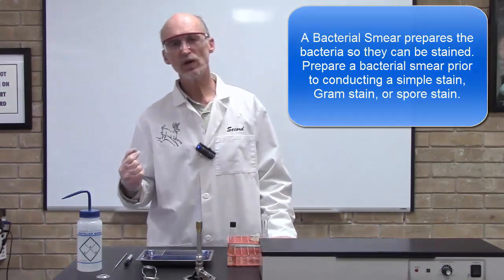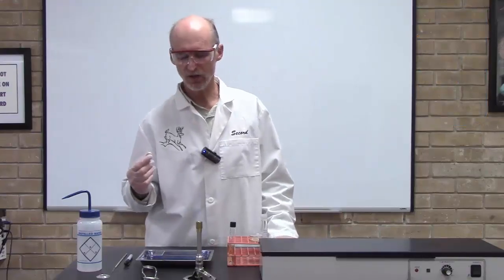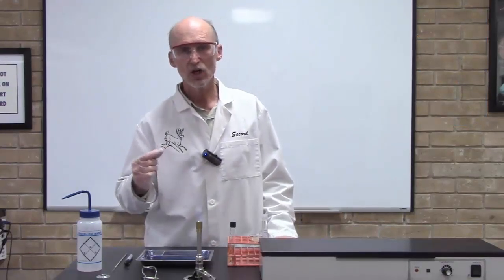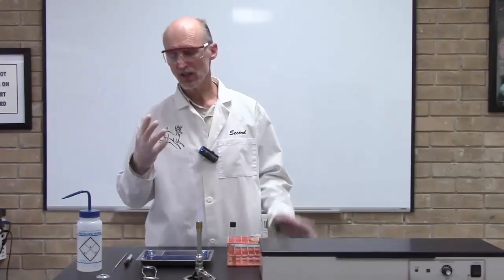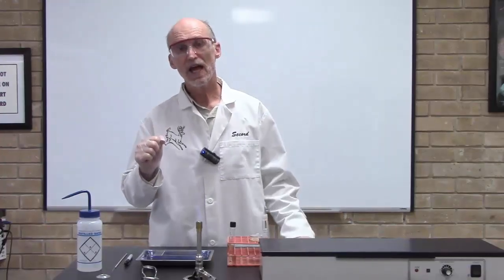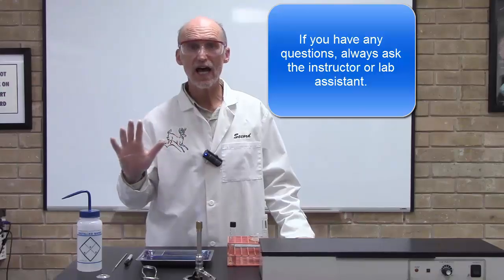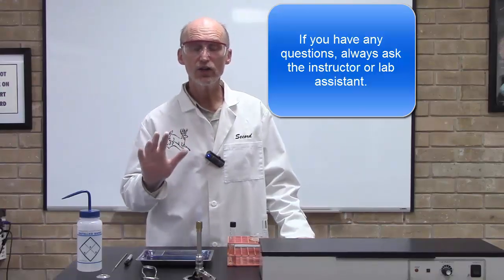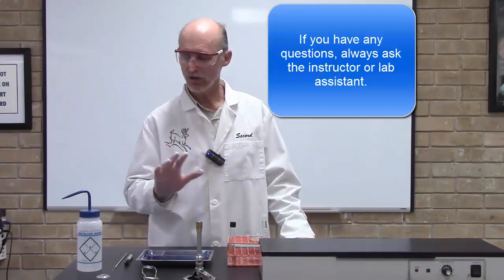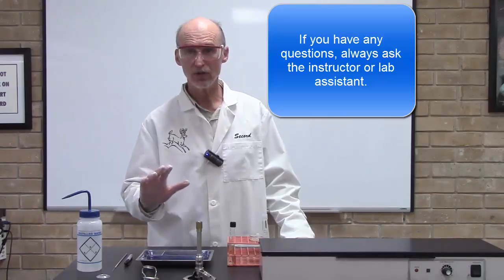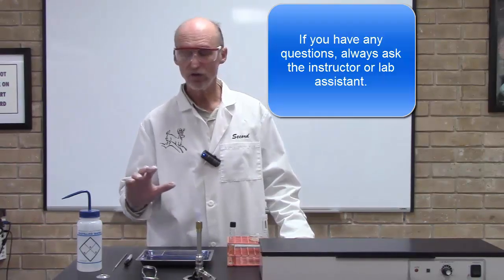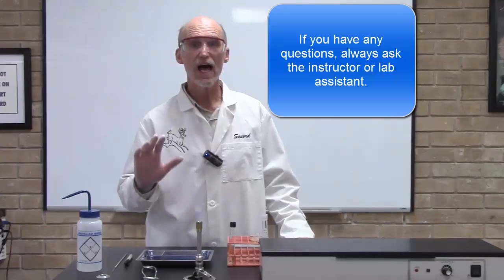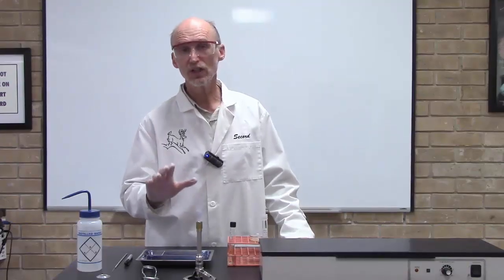Now before we get started, I just want to stress a few things. Remember safety is always number one, so make sure you have your eye protection. I'm wearing my gloves, and if you have any questions at all, talk to your lab instructor. Don't just try to figure it out for yourself. If you're not sure if you have the right equipment or you can't find your safety equipment, ask the lab instructor. That's what they're there for.